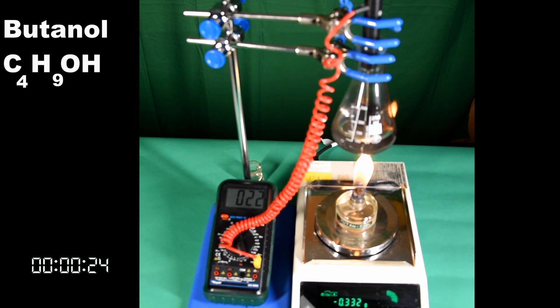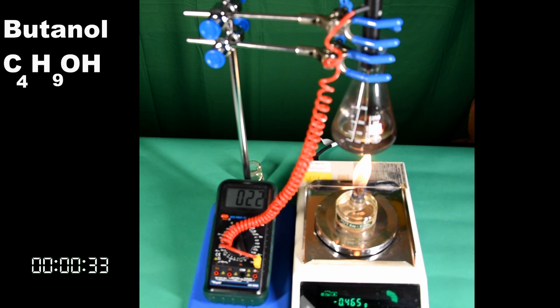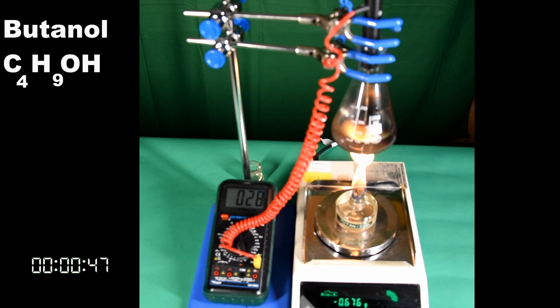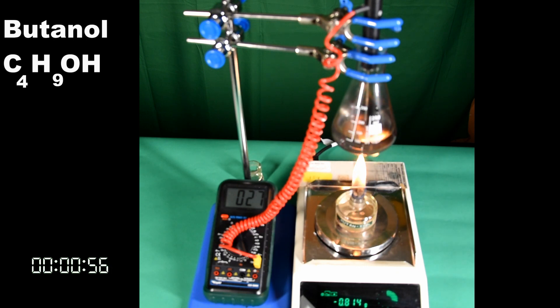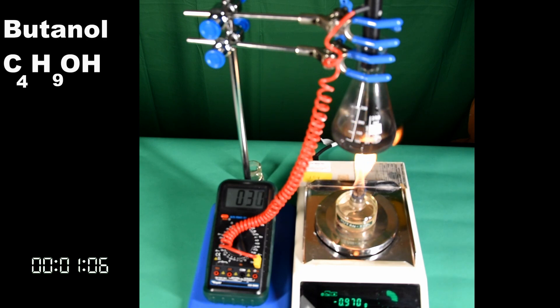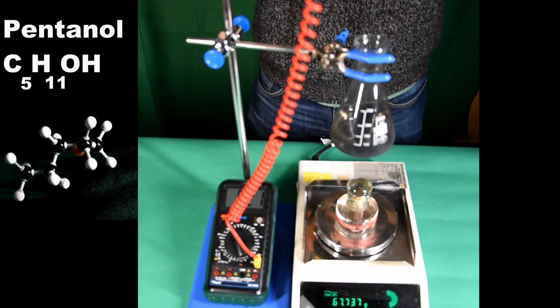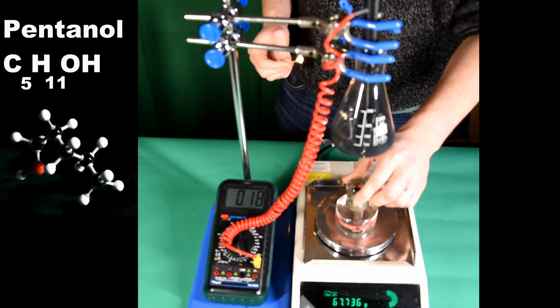The soot from the incomplete combustion deposited on the surface of the conical flask is now quite obvious. And finally, pentanol. Pentanol is not a formula you're expected to know. However, it is the next alcohol in the series, and it's an obvious one to include in the core practical.